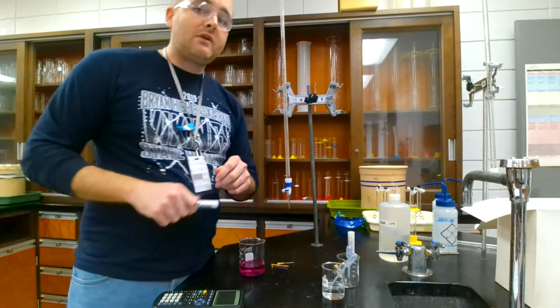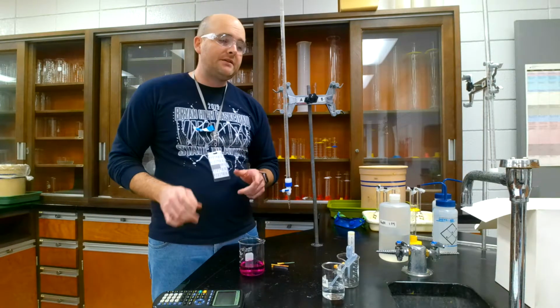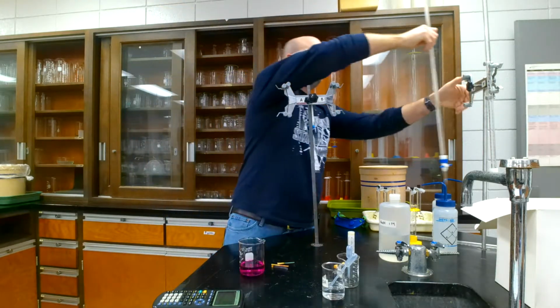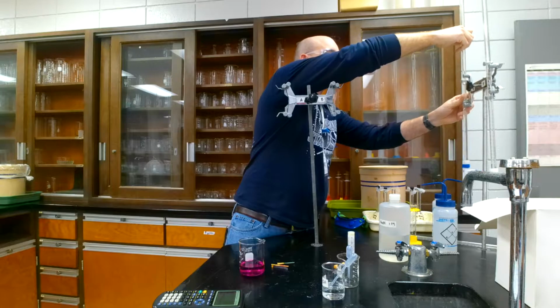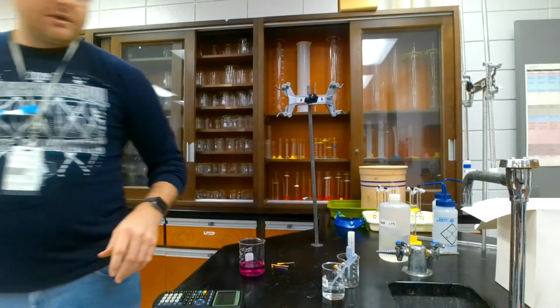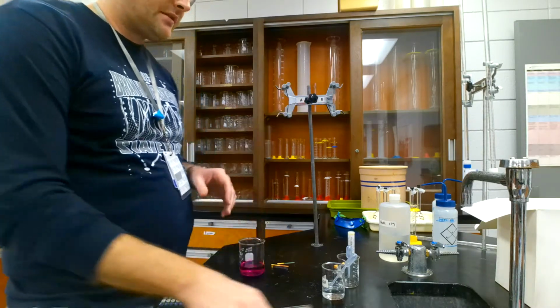So let's try to do some more accurate ones, and let's try to do a different type of titration. It's the same kind of deal, except now we're going to do something that's a count by drops. So this is what you do in class, where you're going to use a well plate. Well plate looks just like this. I just rinsed it out. It's all nice and clean.